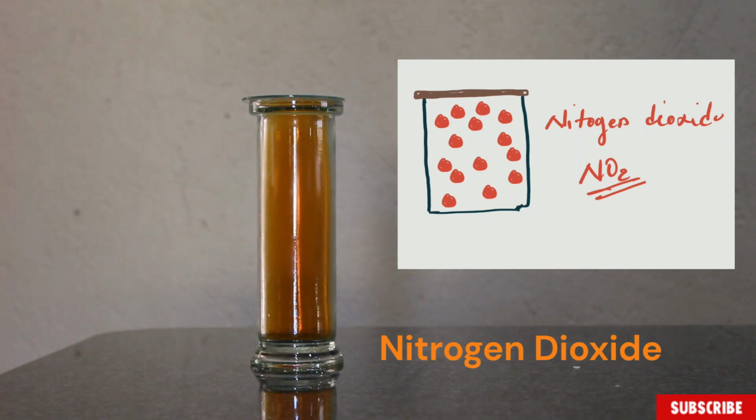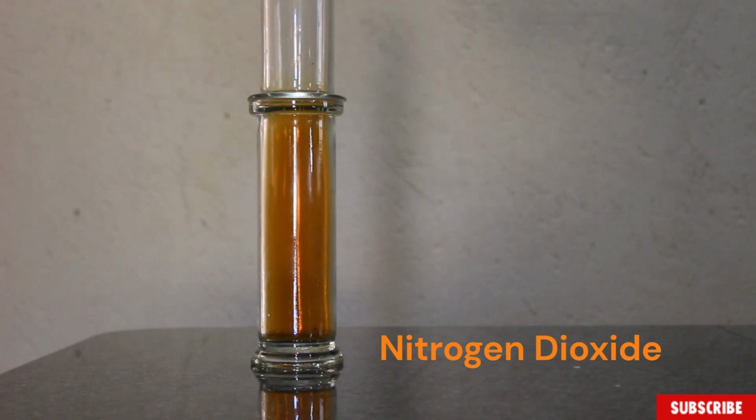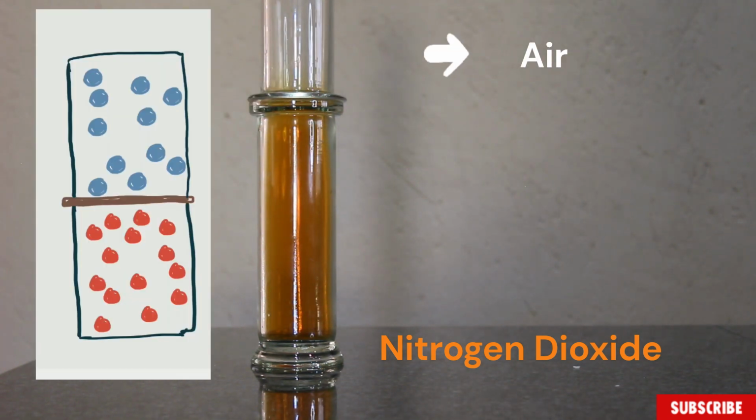So we are going to get another gas jar which looks or appears to be empty, but in actual fact has air inside, and we are going to place the gas jar with air on top of the gas jar with the nitrogen dioxide, and you can see some gas escaping there.